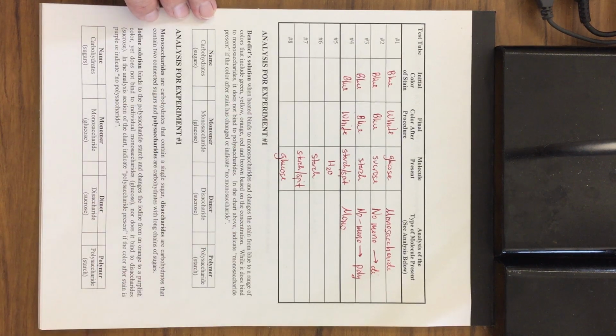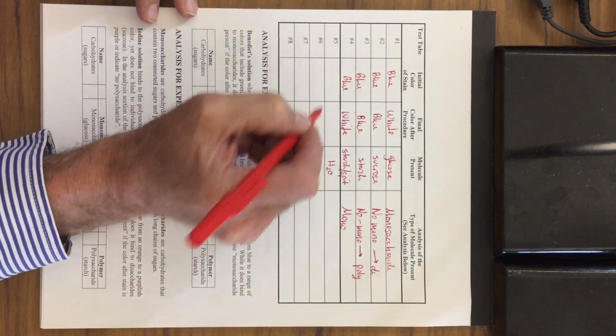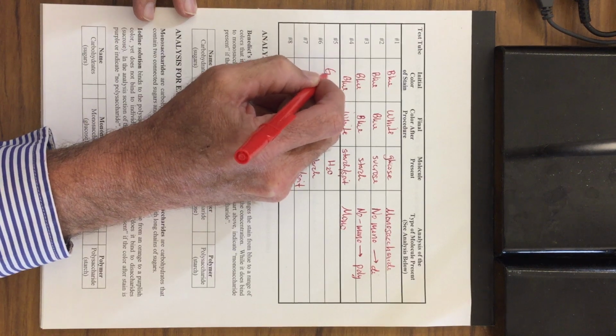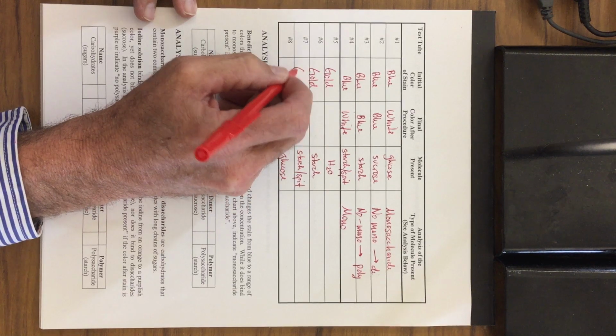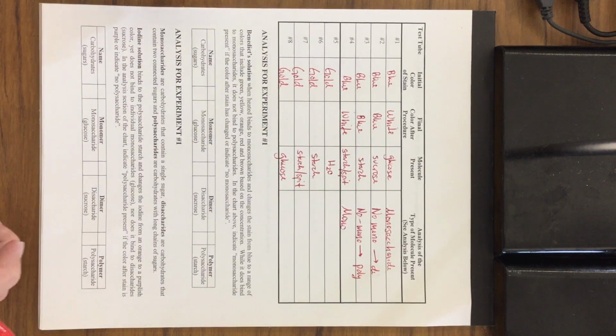In the second experiment, if you remember, we started off with something that looked like this. This is an orangish color. So I'm just going to say it's kind of orange, red, gold, brown. I'm just going to say gold. So iodine starts off with this golden color. And again, we're looking for a difference in color change.